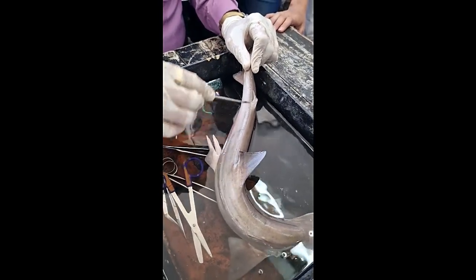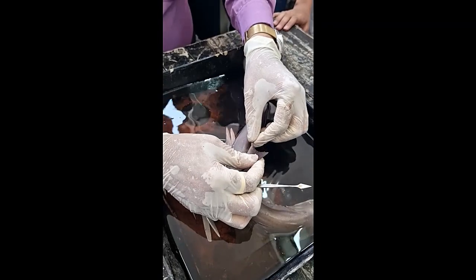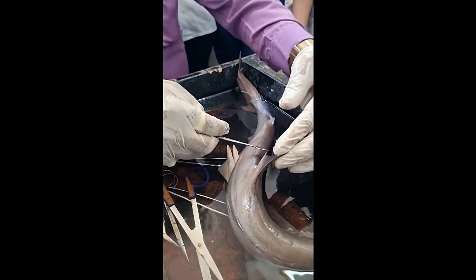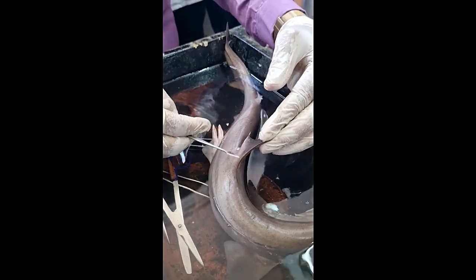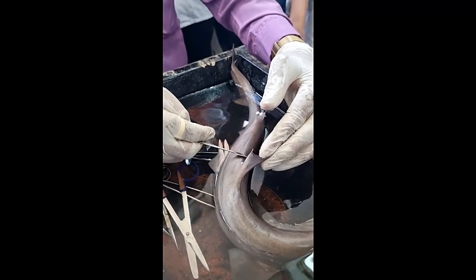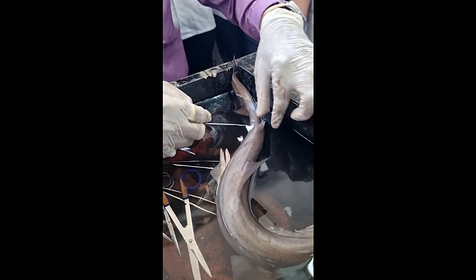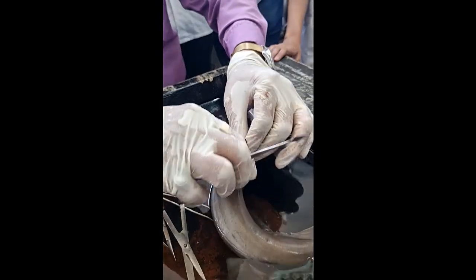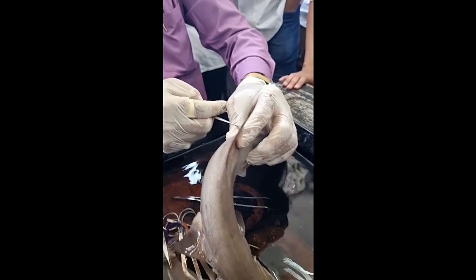There are two dorsal fins — anterior dorsal fin and posterior dorsal fin. You will find these have a little tip here, but there is no spine — it is soft. This particular shape varies in each species; different species will show different shapes. And depending on this shape, you can identify the shark.